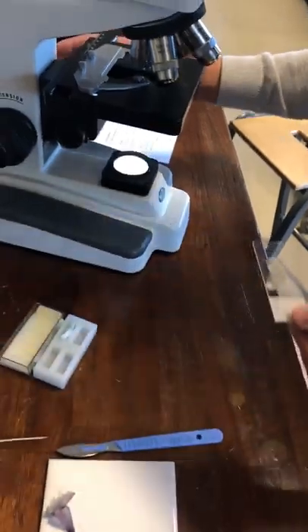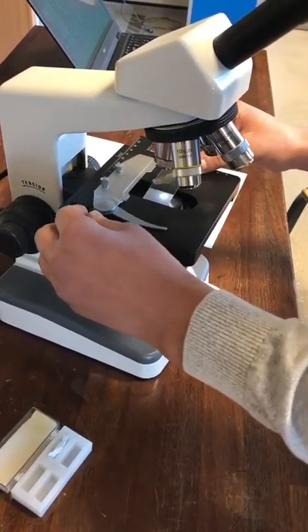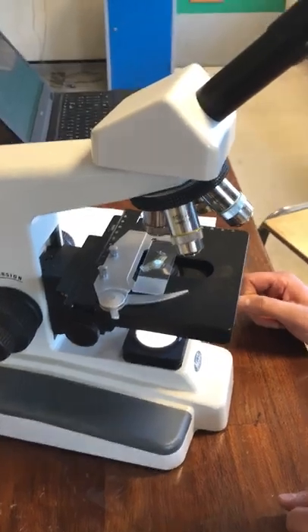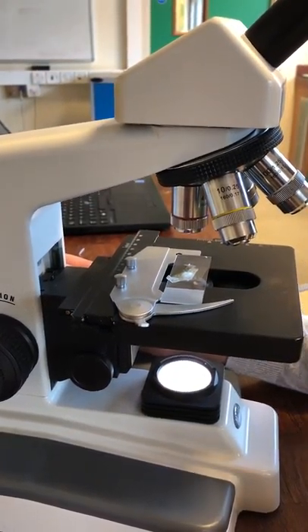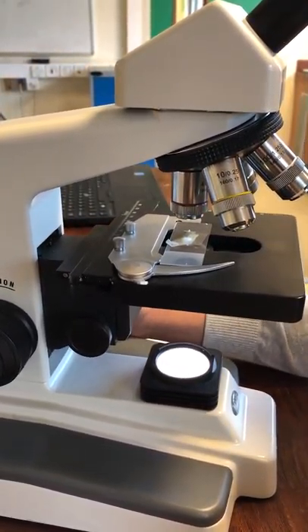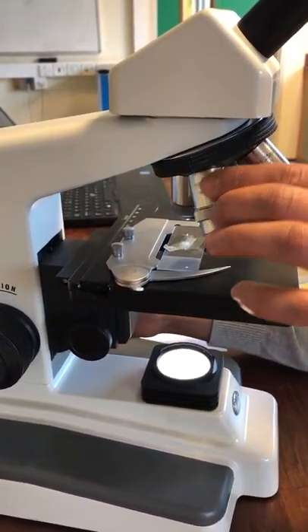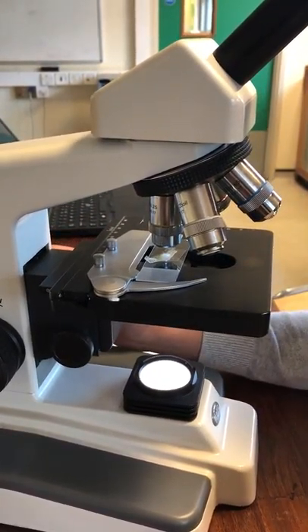At this point go to your light microscope, make sure you've got plenty of room to put it underneath. You want to start off at its lowest magnification, because you want to make sure you're pinpointing the exact area you want to look at — if you start with the largest magnification it's quite hard to find. Go quite close, then start to use your fine focus rather than your coarse focus, and you'll get a good image. Then you can choose, if you need to, to up the magnification gradually — again, start with the coarse focus and then move to the fine focus.